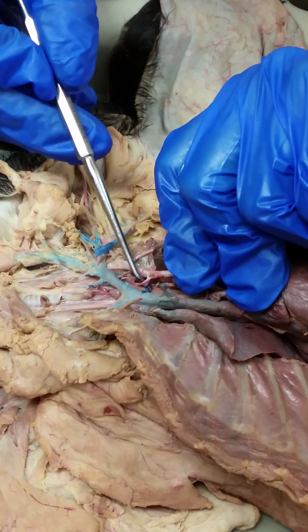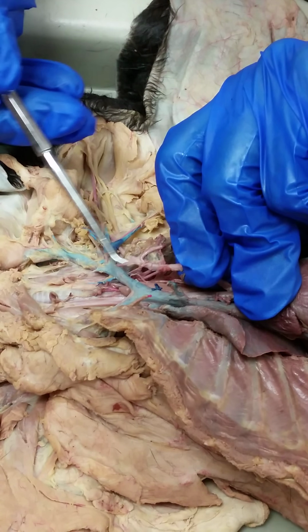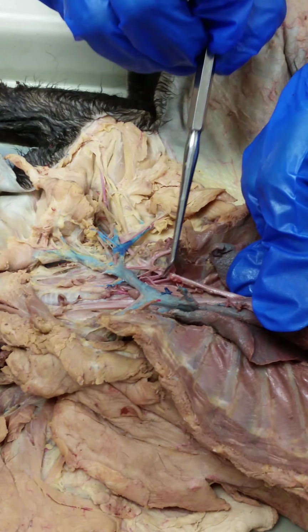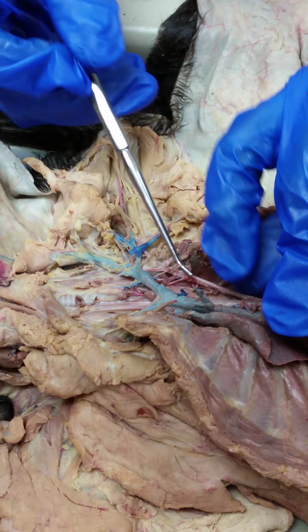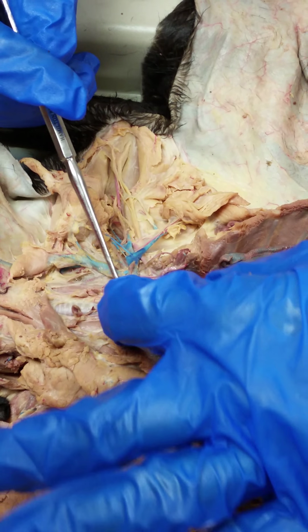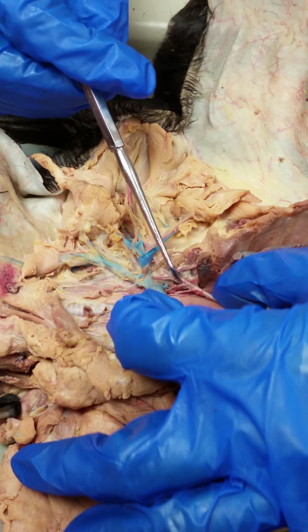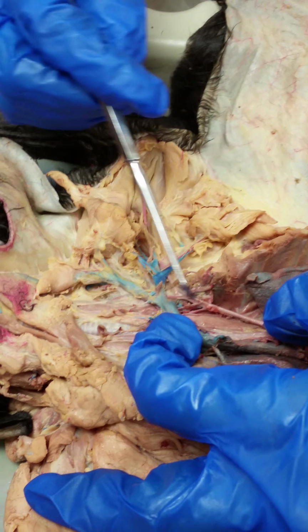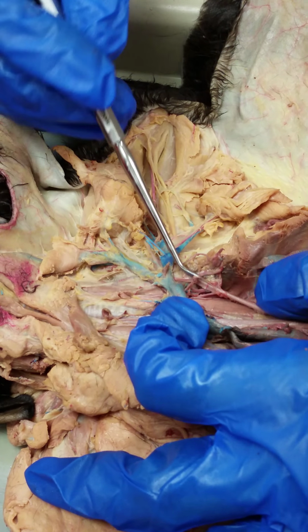You have the vertebral, the costocervical, and the thyrocervical. So 1, 2, 3, right before the first rib here. So vertebral, costocervical, thyrocervical, and you can ignore this little branch. I'll probably actually cut it off because it's an irregularity. But it's actually kind of interesting to see this cat actually has like an extra branch connecting its left common carotid to its left subclavian, like a bridge artery that is atypical. So we'll probably cut that one off because it's not important.